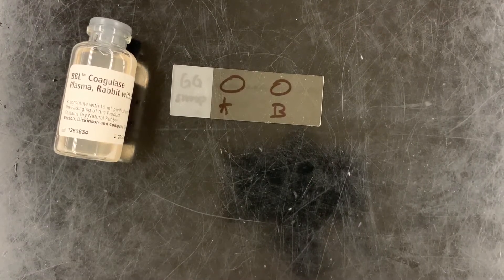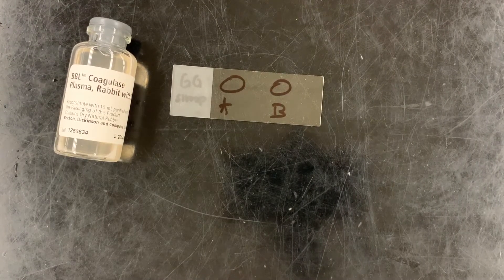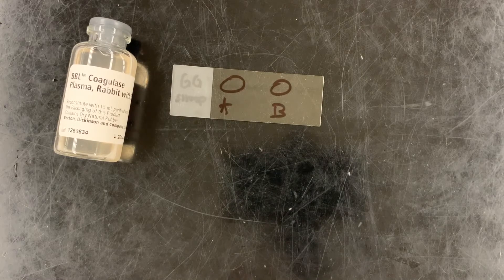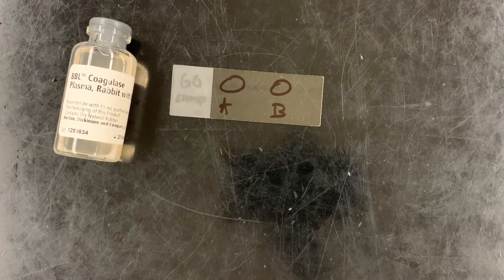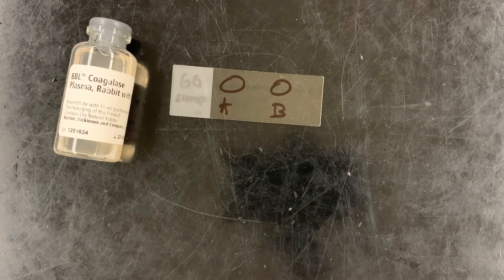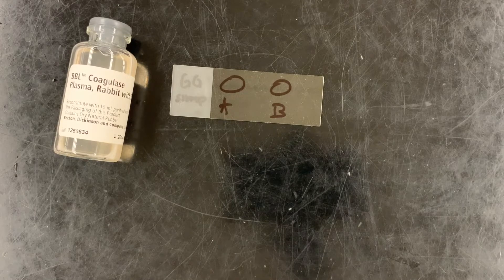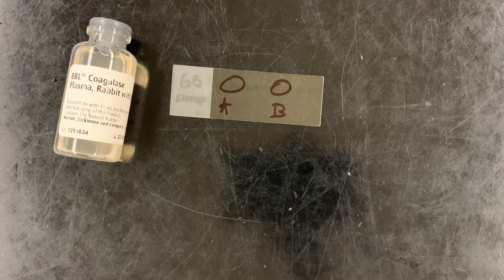The coagulase test determines whether a bacterium produces an enzyme called coagulase. Coagulase is produced by some pathogenic bacteria and can be used to coagulate blood, or cause blood to clump.